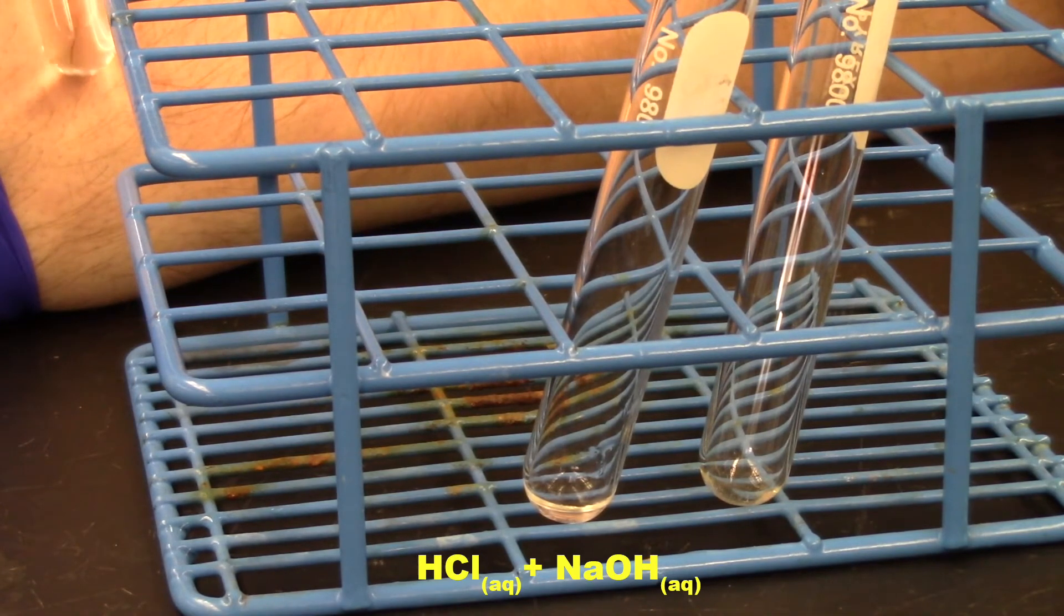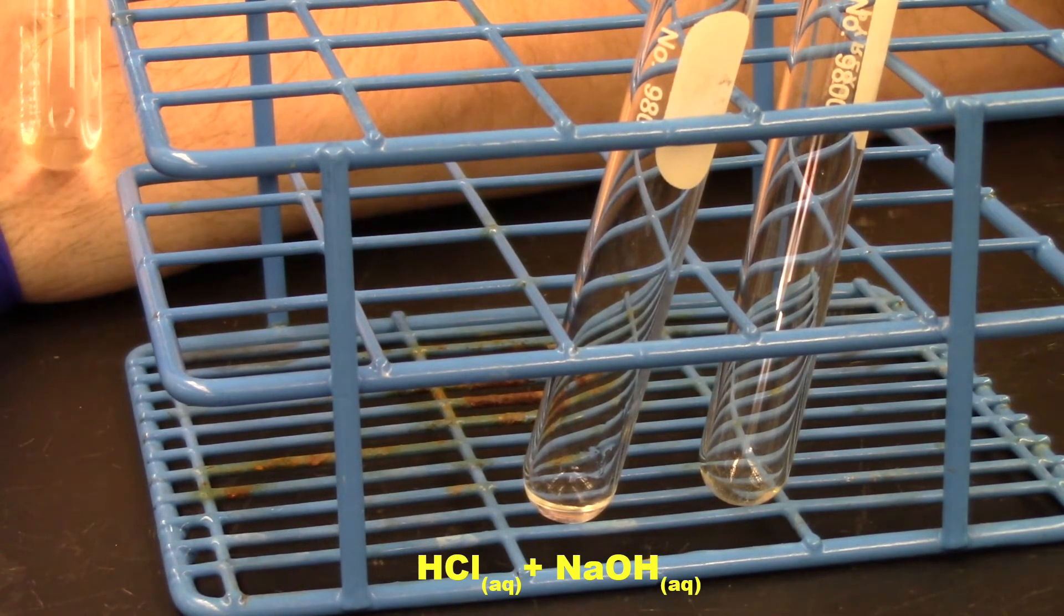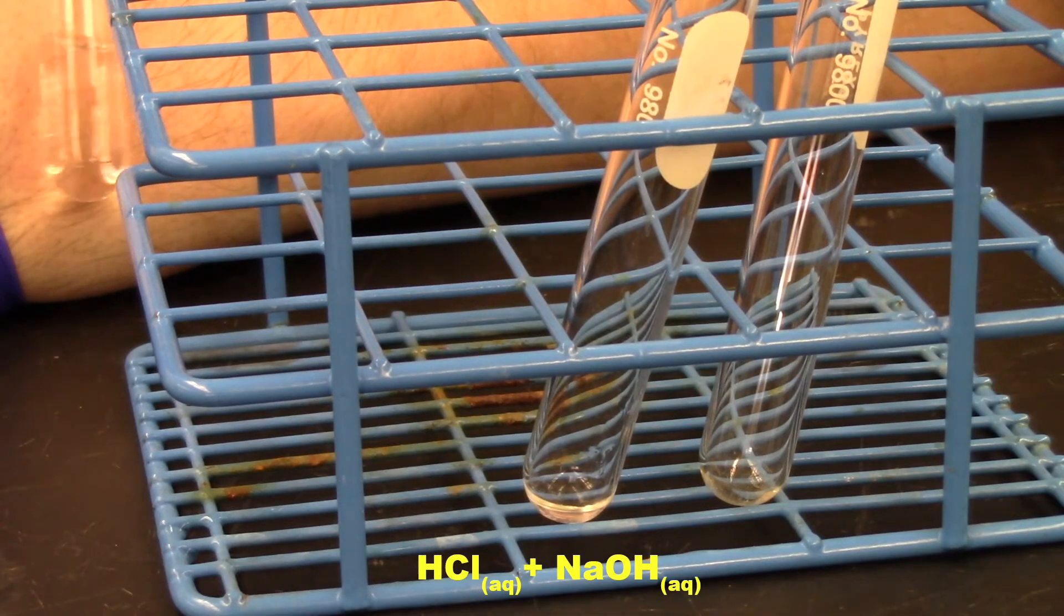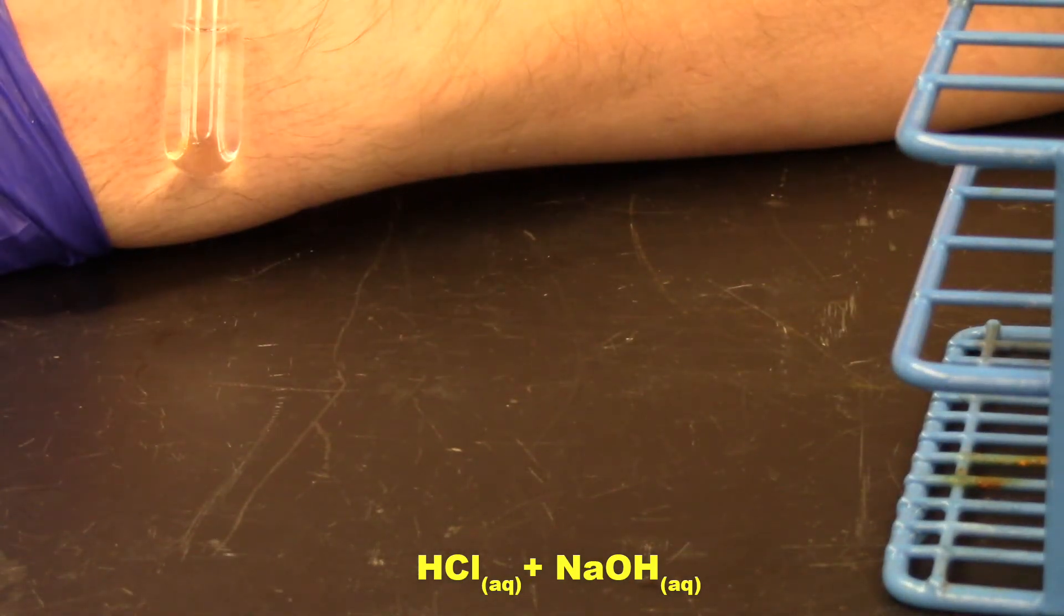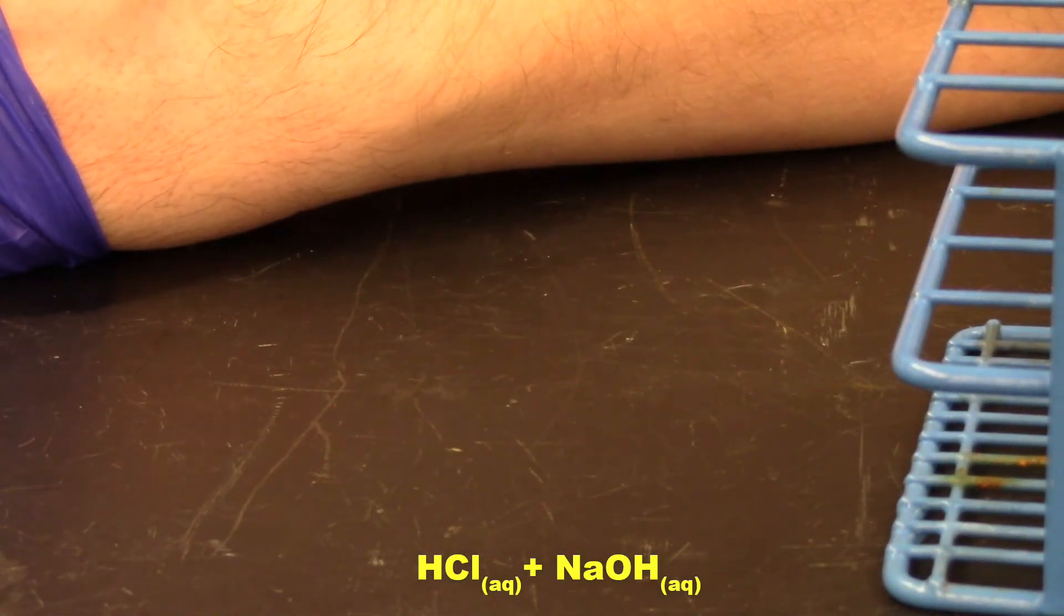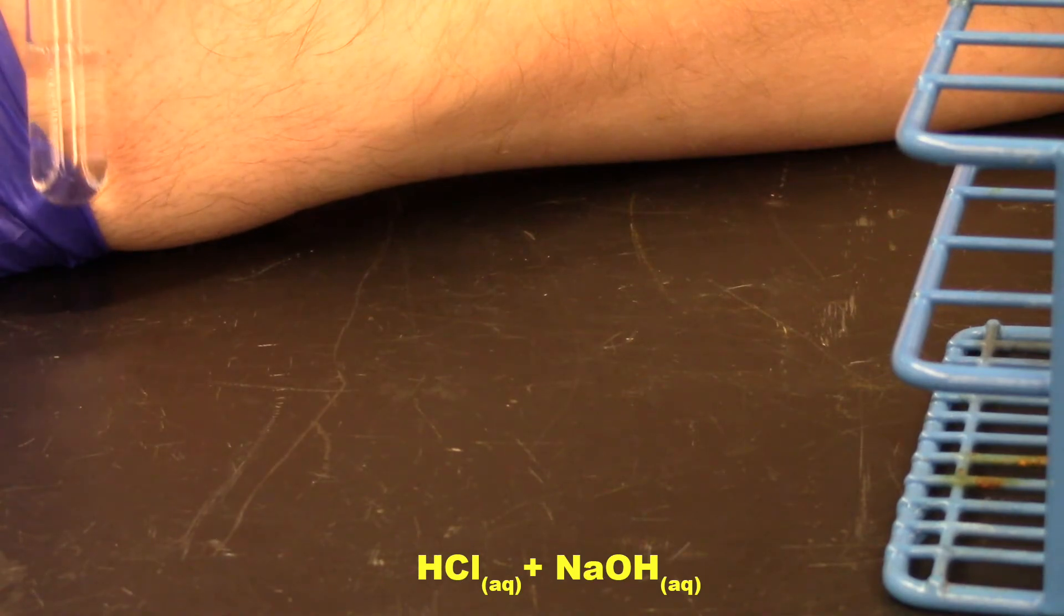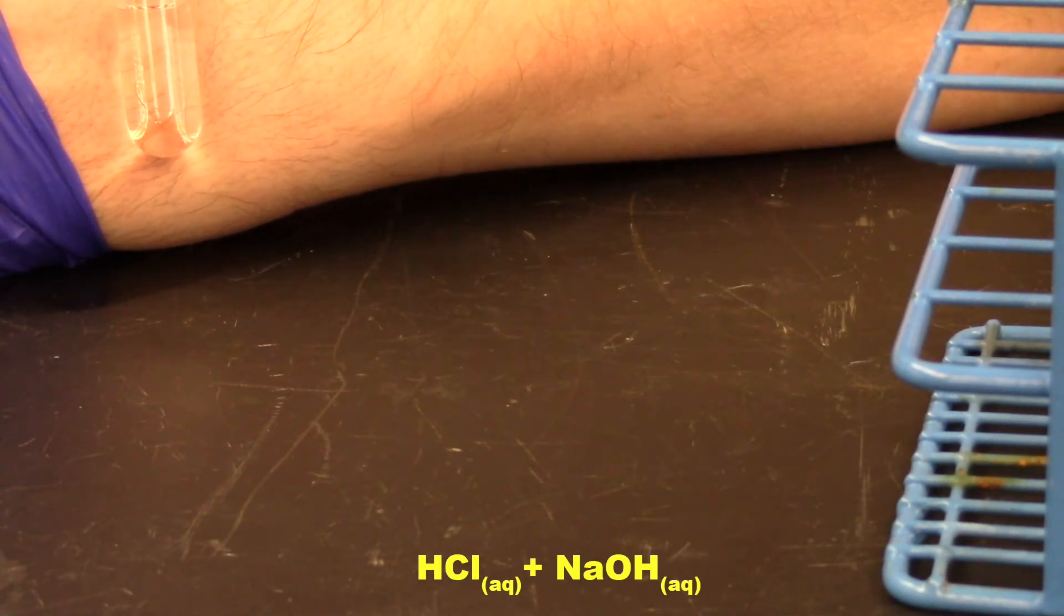And now I'm touching the test tube to it. And I can feel there's definitely a temperature change going on here. So there's definitely a chemical reaction between these two substances because it's getting warm. Now it's not hot. It's not going to burn me. But I can tell it's not room temperature. It's a little bit warmer. These two things mix together to give off heat.